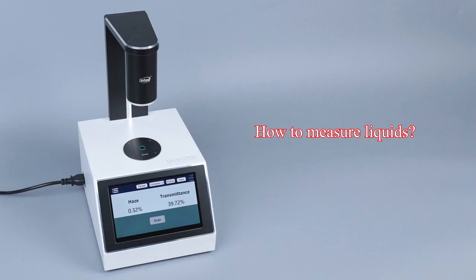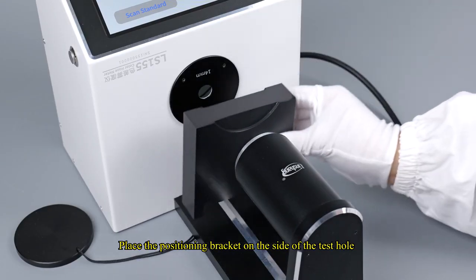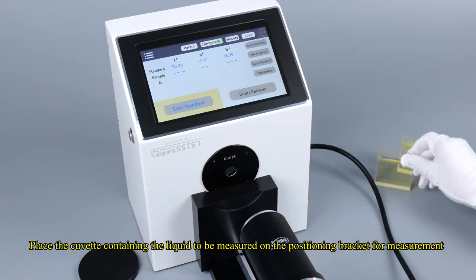How to measure liquids? If you want to measure liquid, you can place the instrument horizontally. Place the positioning bracket on the side of the test hole. Place the cuvette containing the liquid to be measured on the positioning bracket for measurement.